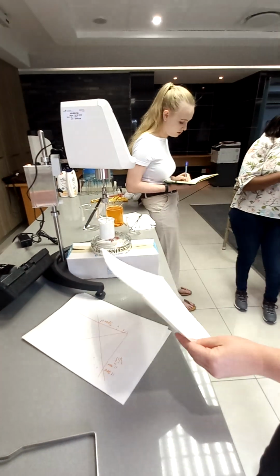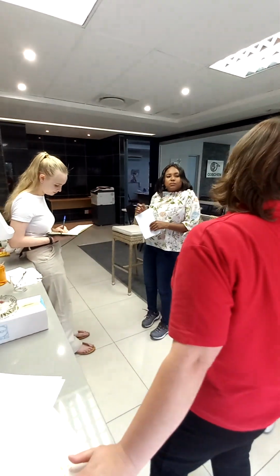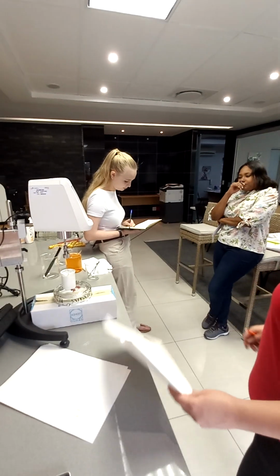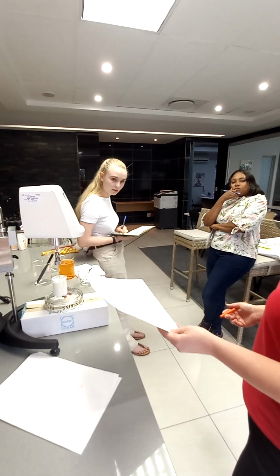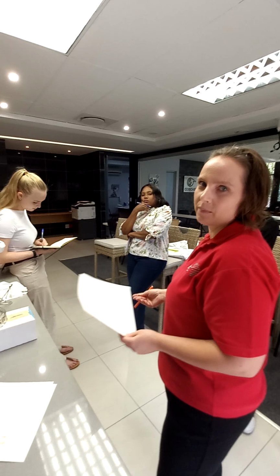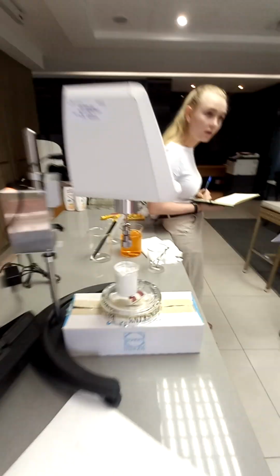Okay, so when you record it, you can either do the whole graph. Again, a rheometer with a cone and plate is so much better for creams and much more accurate. But this is good. This is a standard used in many cosmetic personal care products. Yeah, we've got many customers using the Helipath setup.